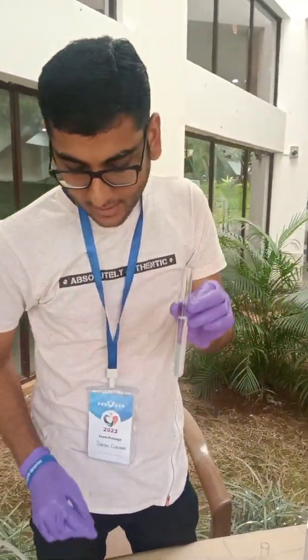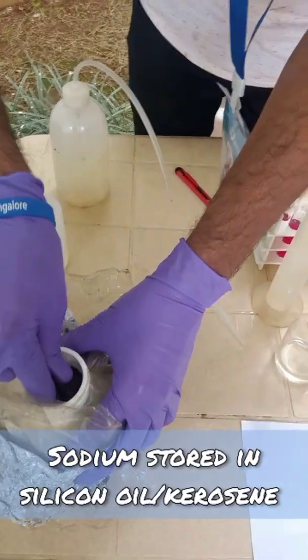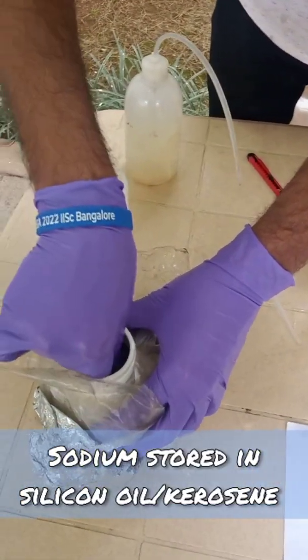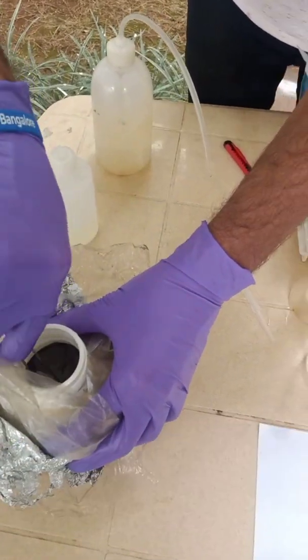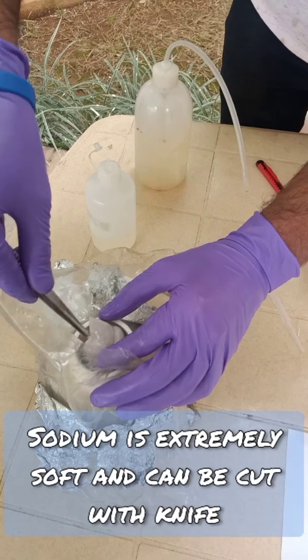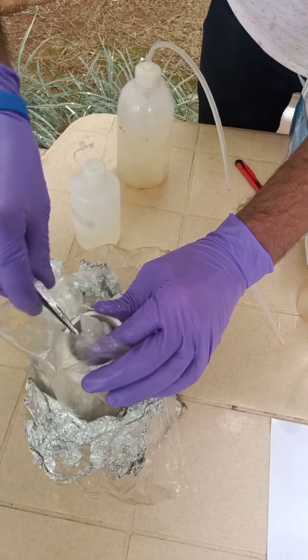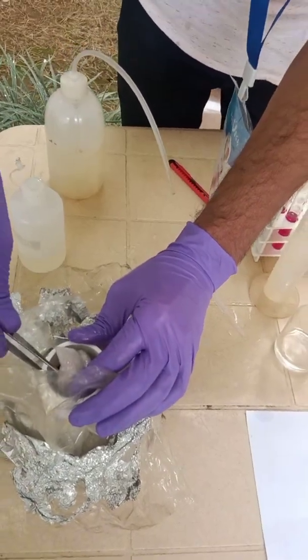Now I will add some sodium metal. Kerosene is the perfect one, but we are storing it in silicone oil. This is a very big chunk — sodium can be cut with a knife, it's very soft. I am cutting it with my hands using forceps.